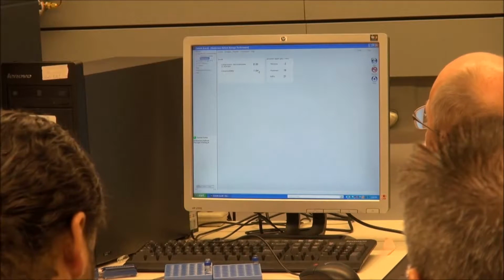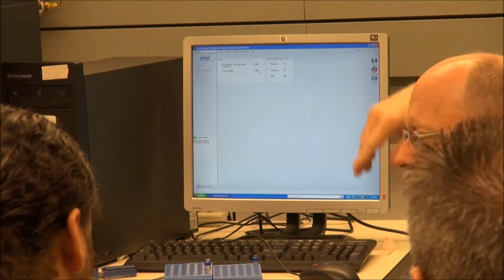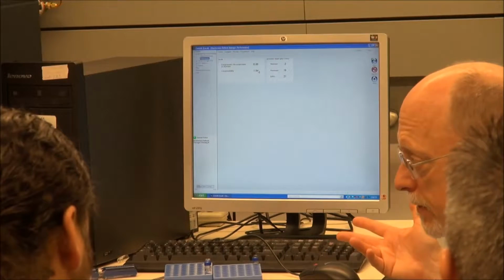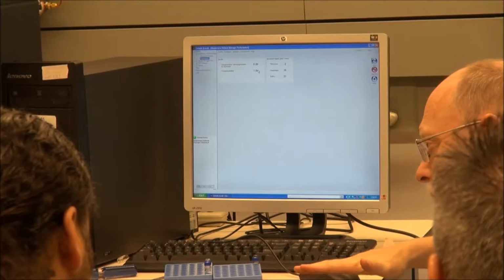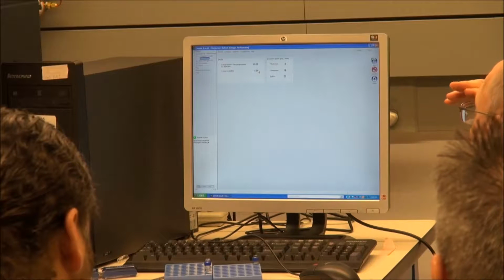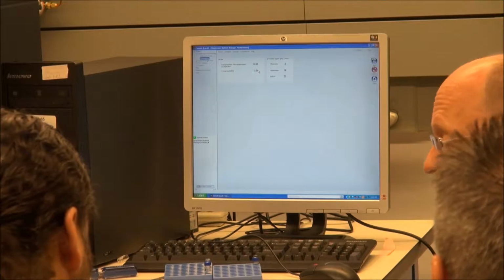What happens is this thing computes a C to D ratio, compression to decompression ratio. 1.0 is the ideal case. You'll never get to the ideal case. It'll go like this, never reach the ideal case, which is the asymptote, right? So your ideal case is 1.0 or close to it.